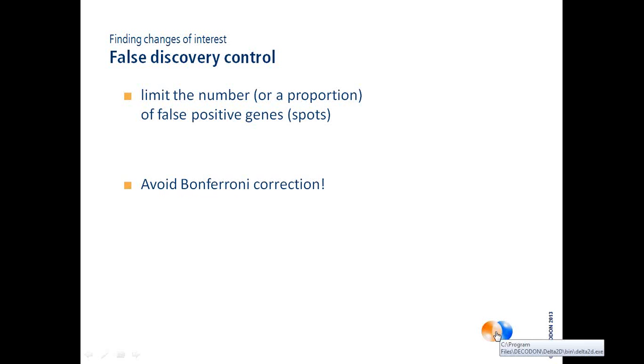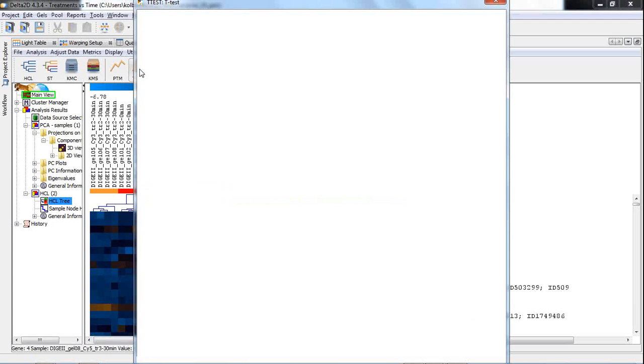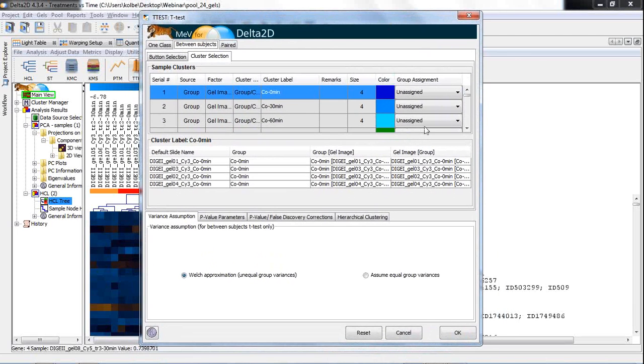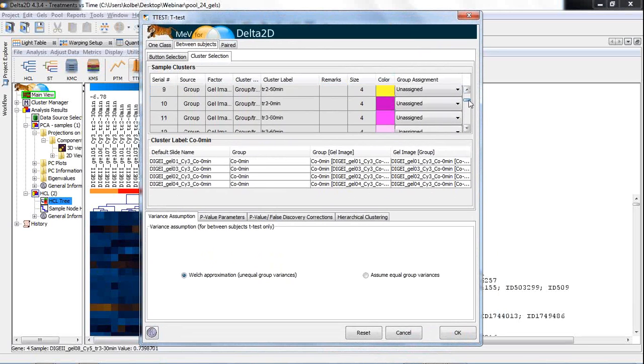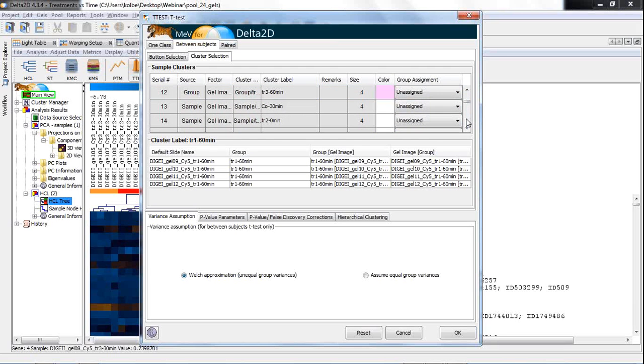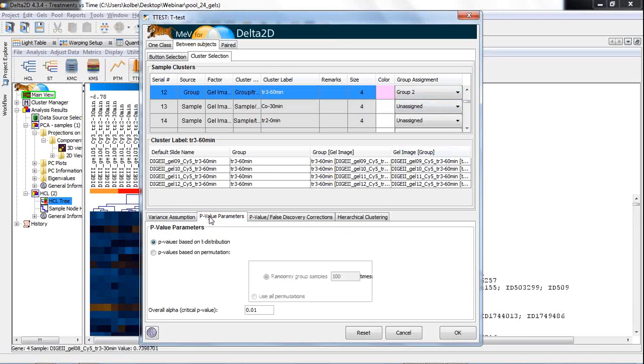Let me show this now in Delta 2D. So first, let's have a look at the t-test. I open this t-test dialog. Let me make it a little bit smaller, like this. And then we have here a list of the groups. We can scroll down, and then we have to select now two groups that we want to compare with the t-test. For example, let's take treatment 1 60 minutes as group 1 of our t-test, and treatment 3 60 minutes as group 2. Then we want to use a certain p-value. 0.001 is very strict, but it should be good, like this. And we want to use p-values based on permutations. I will explain that within a few minutes.